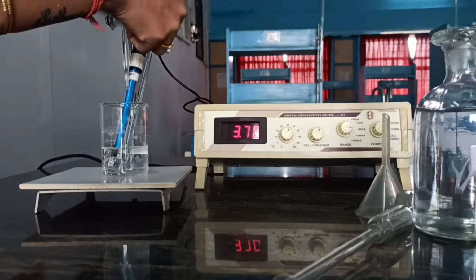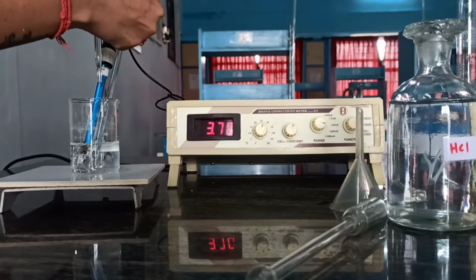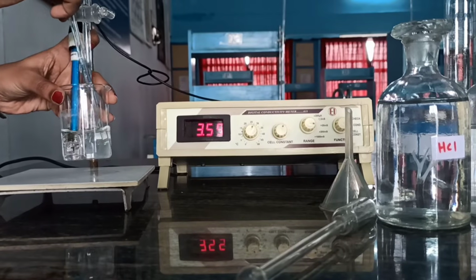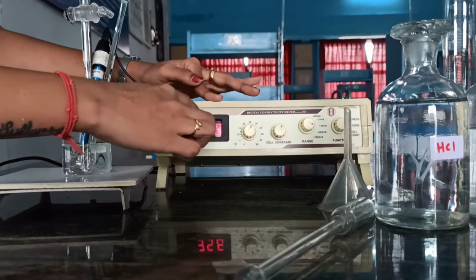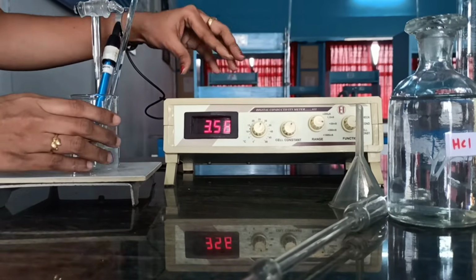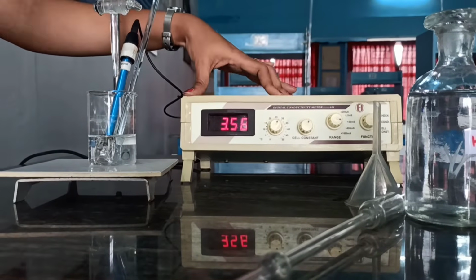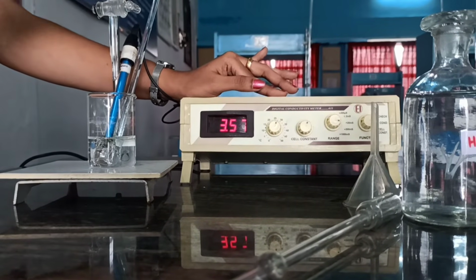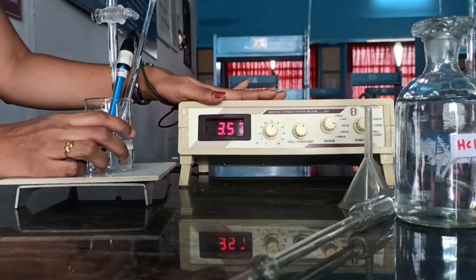Similarly, we have to continue the titration by adding 1 ml of the burette solution, that is the standard solution, to the unknown solution, so that the conductance of this solution will go on decreasing. Each addition of the burette solution, that is sodium hydroxide, to the HCl solution, and the conductance observed should be measured constantly with 1 ml differences. By noting down the conductance values and the volume of sodium hydroxide added to the hydrochloric acid solution, you can observe the changes in the conductance.